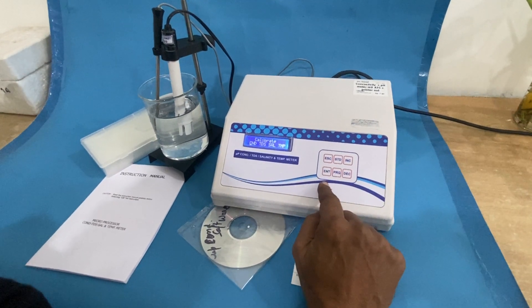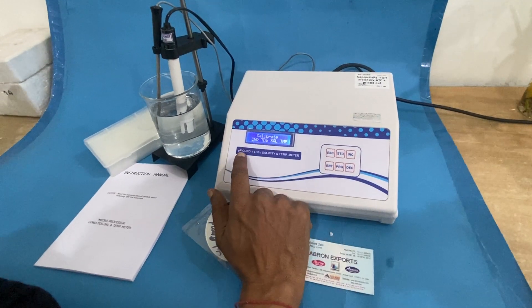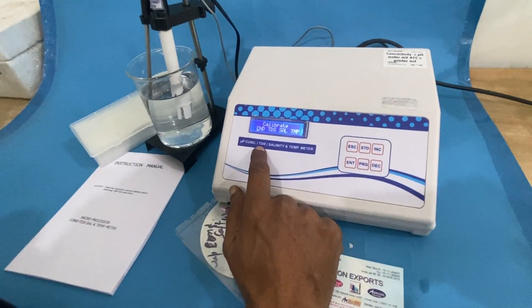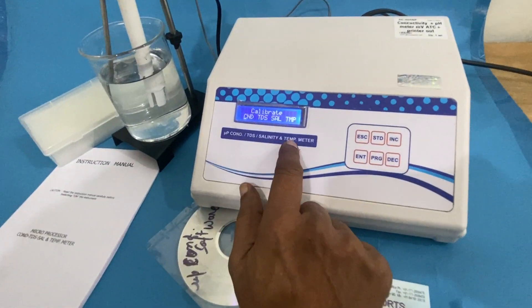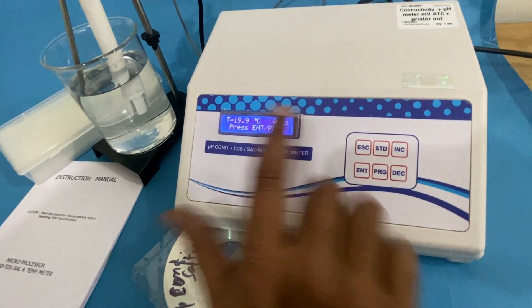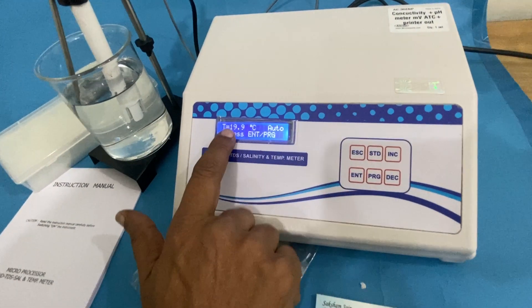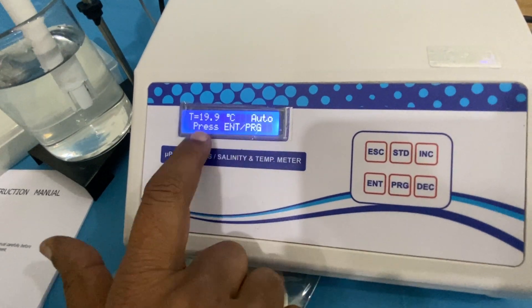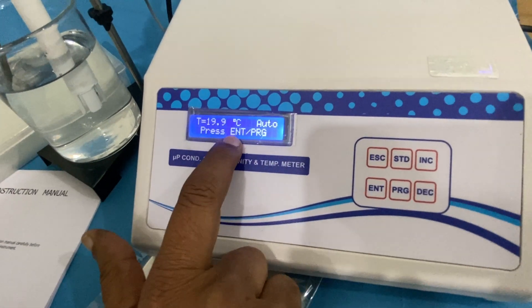Let us learn the programming of this conductivity, TDS, salinity, and temperature meter. When you connect it, it starts like this with the temperature showing here automatically.